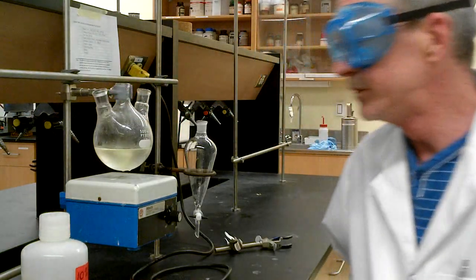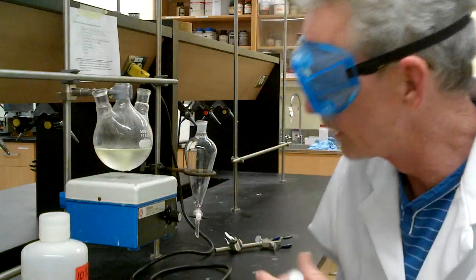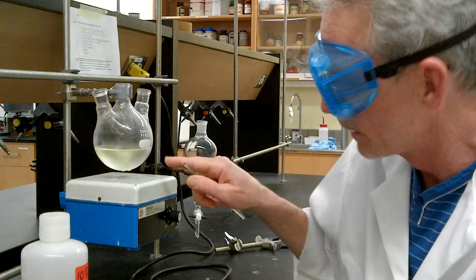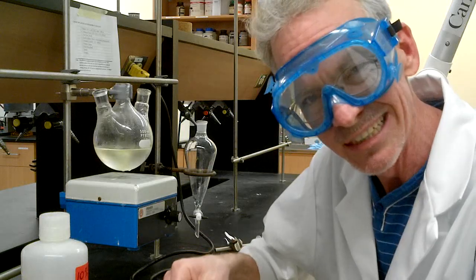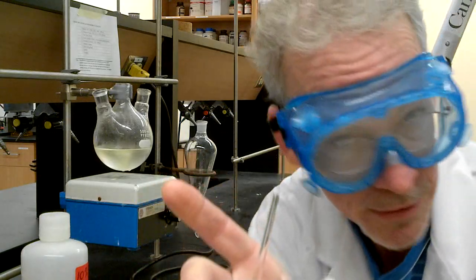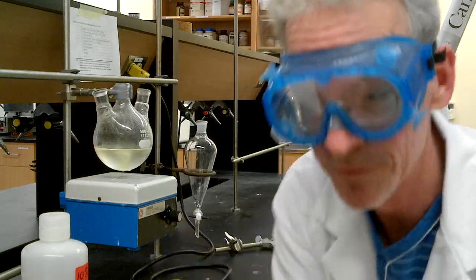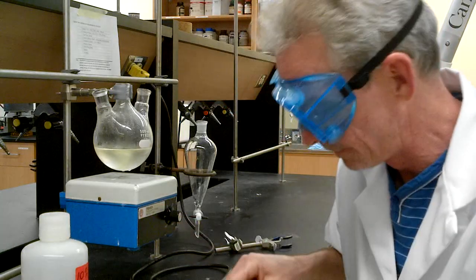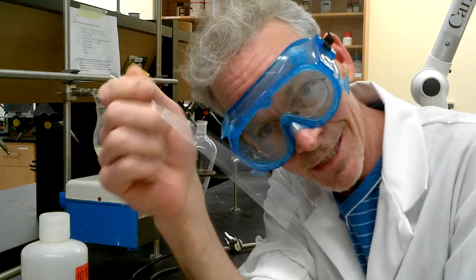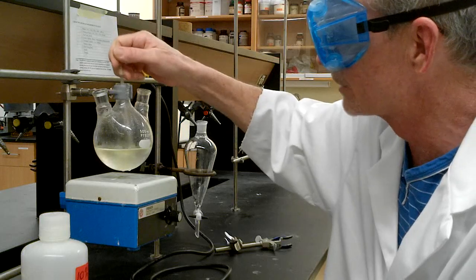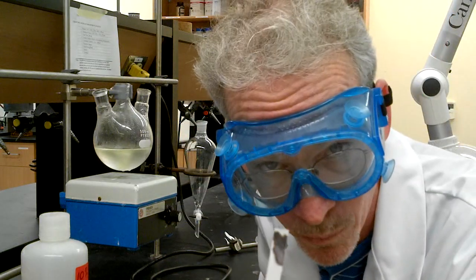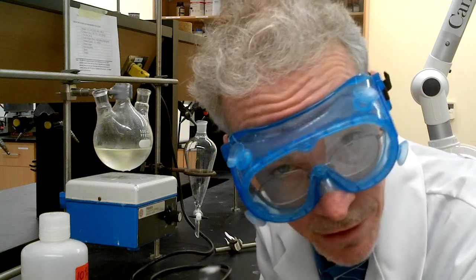Okay, our addition is done. We've stirred it. Now, so I've taken everything apart and rinsed it with cold water. But there may still be unreacted bleach. And there may be a fair amount of bleach. So we have potassium iodide starch paper. So if there's any bleach left over, it will cause something to happen. And actually, this is what the glass rod is for. Dip your glass rod. Put a drop on the paper. And, uh-oh. We've got unreacted oxidant.